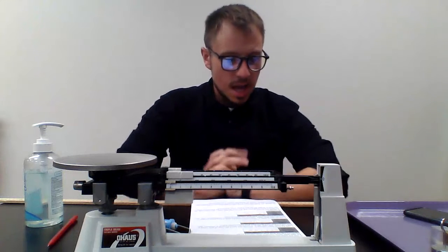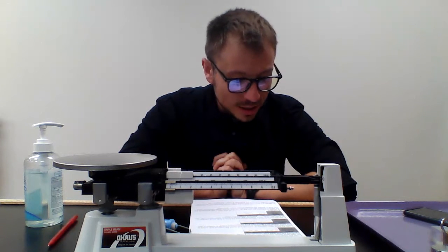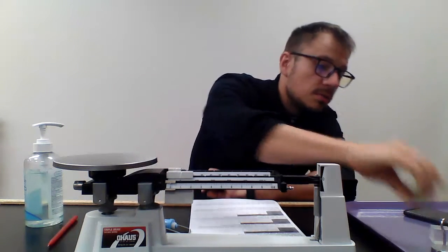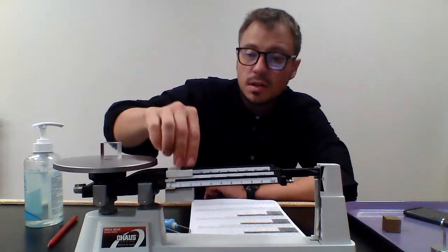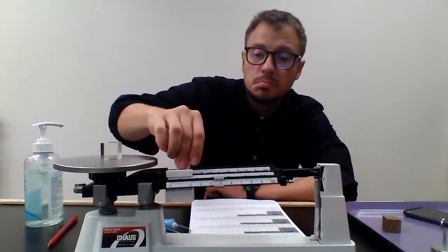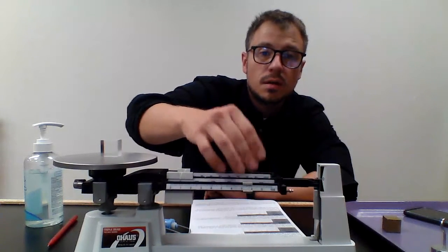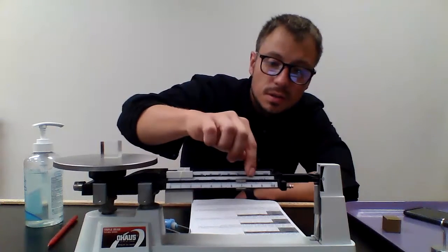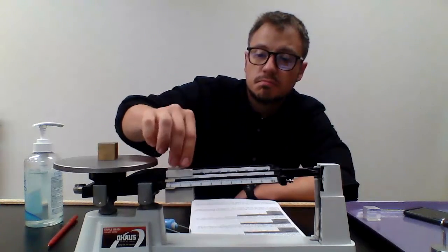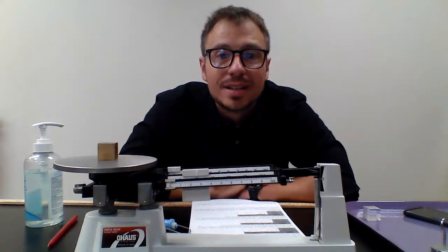Use the triple beam balance to measure and record the mass of both cubes in grams in the data table below, then convert those measurements to kilograms. How many significant figures does your measurement have? There's a plastic cube and a metal cube. Place them on the triple beam balance and find the mass — you want to make sure the beam is level and even. That reading is going to be 130-something grams. Then you convert the result to kilograms.